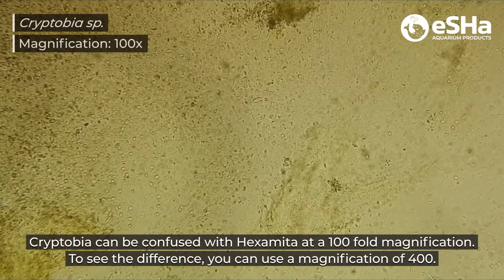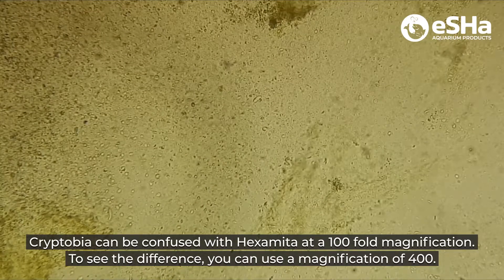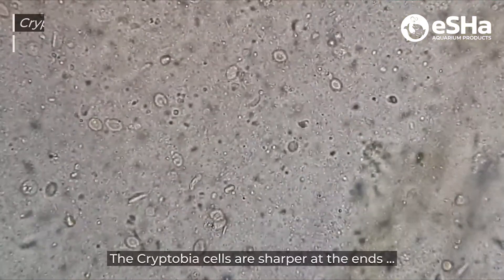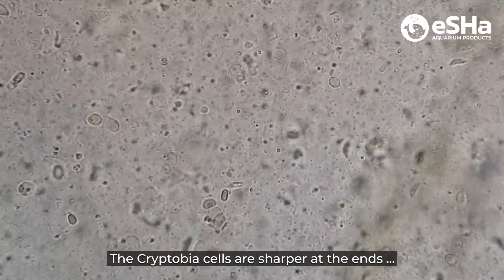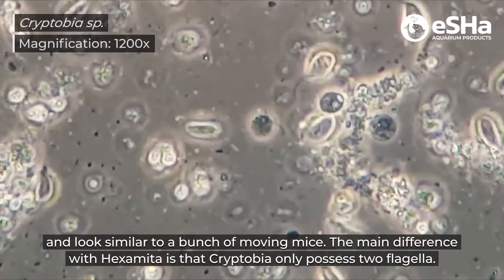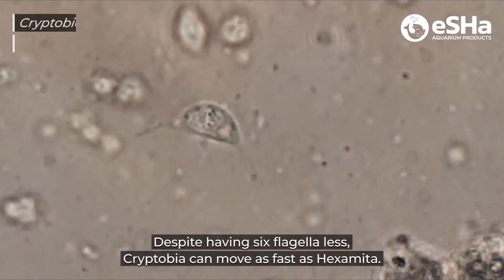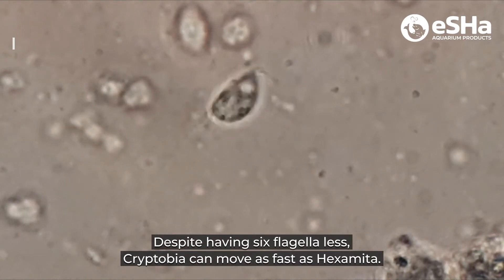Cryptobia can be confused with Hexamita at 100-fold magnification. To see the difference you can use a magnification of 400. The Cryptobia cells are sharper at the ends and look similar to a bunch of moving mice. The main difference with Hexamita is that Cryptobia only possesses two flagella. Despite having six flagella less, Cryptobia can move as fast as Hexamita.